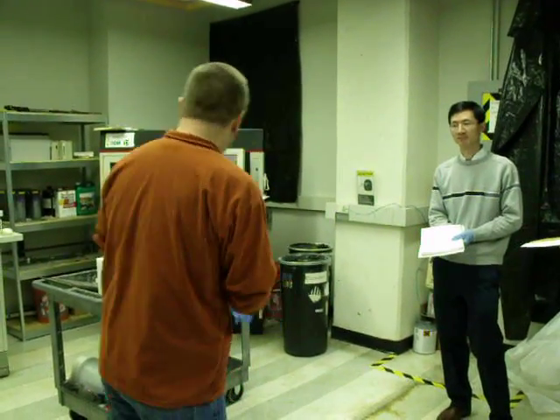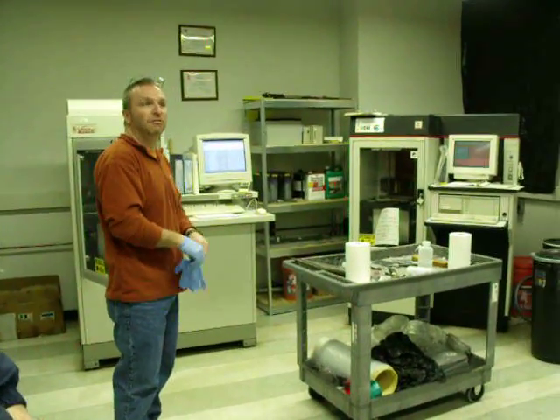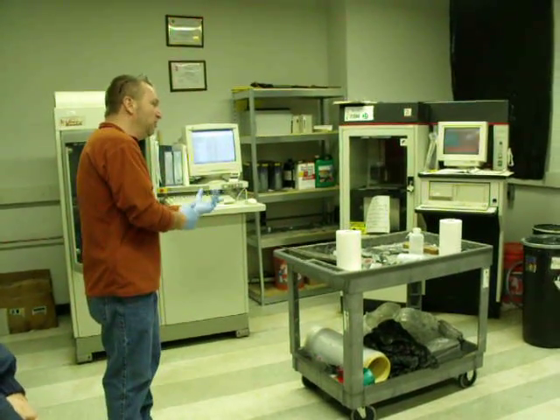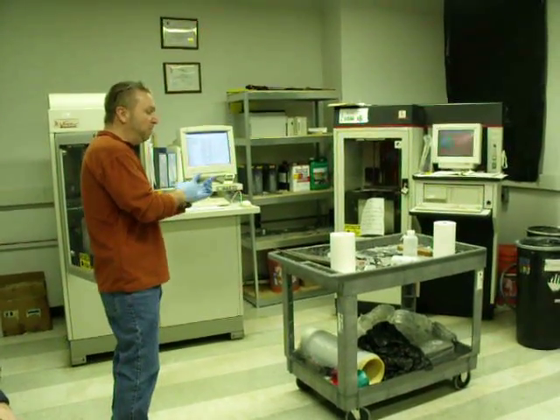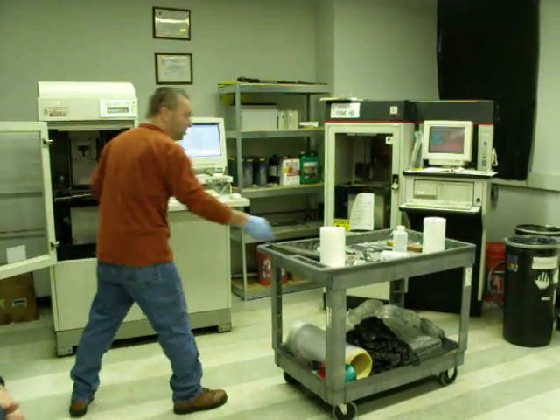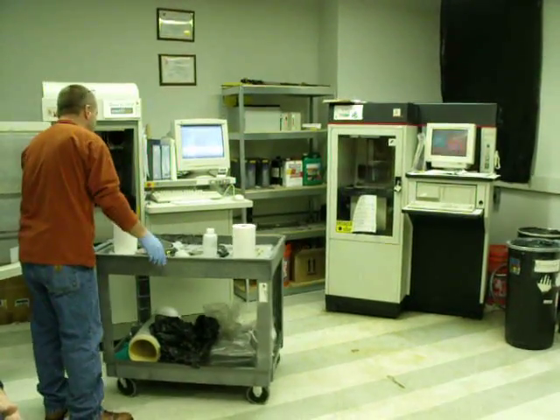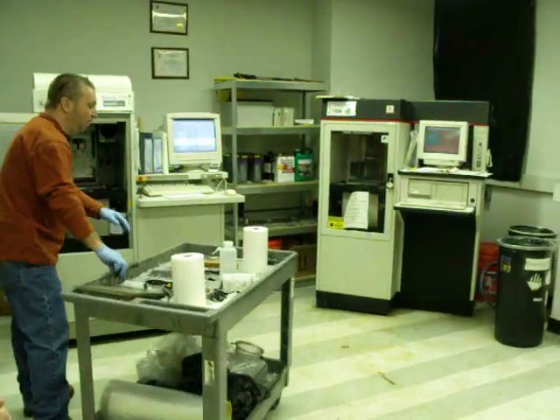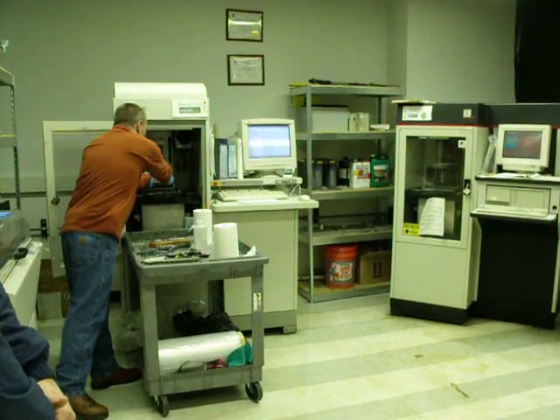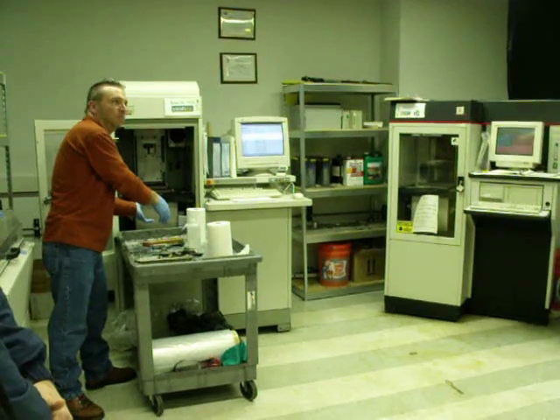So what everyone should be doing, and again, this may be all repeat for you. You may already know all this. In this cart, it probably wouldn't hurt to get a new cart. This cart is in pretty foul shape. When you have a platform in the machine, you should roll this cart all the way up. I typically would roll it all the way up, take your platform out and come here. If you're doing that, then the resin is not going to get on the floor.